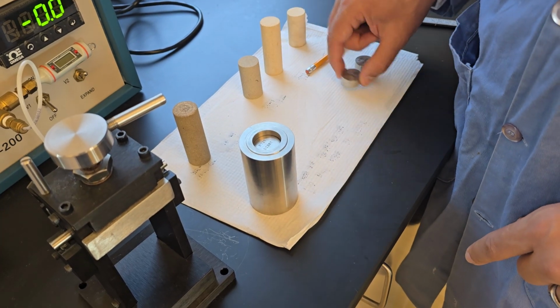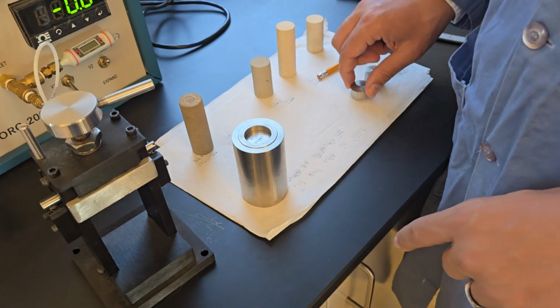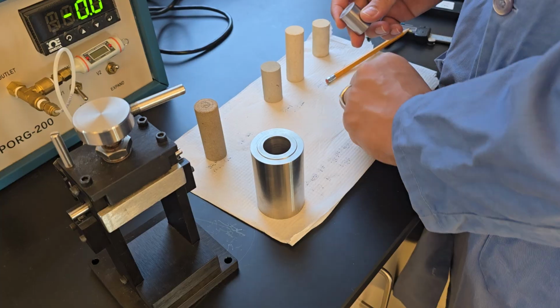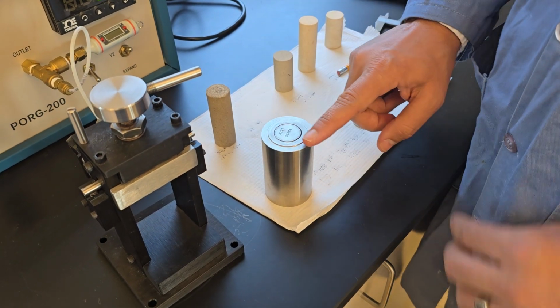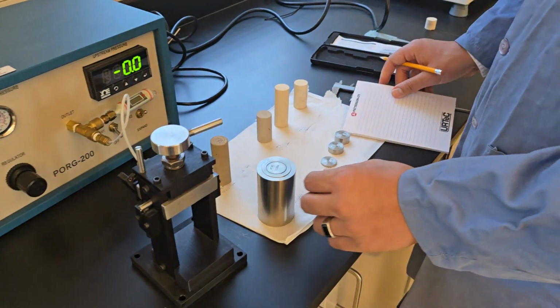Oh, that's not enough. I need more. I'm going to put in more, so I need to try another sequence. I keep trying different ones until I find the best. So I'll go with the biggest one, followed by the second biggest. That's good. So the first thing I'll do is go to my equation sheet and type in that I used these discs.